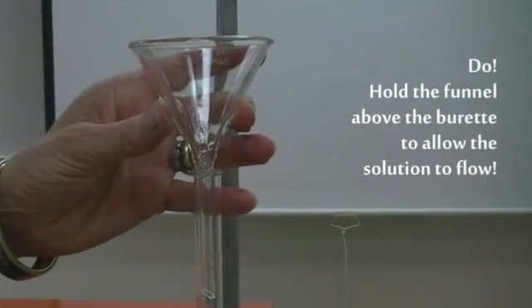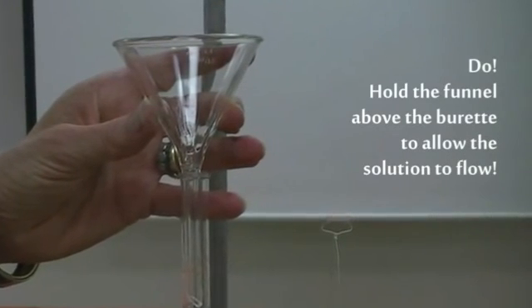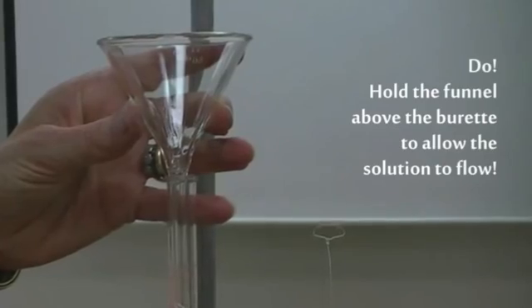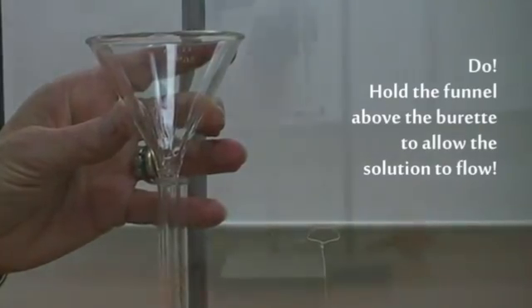Hold the funnel above the burette to allow solution to flow. Have a space between the burette and the funnel.